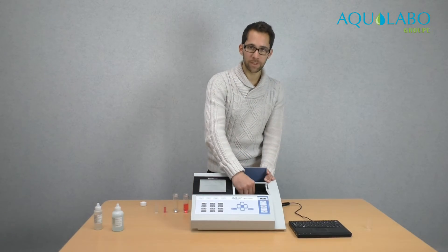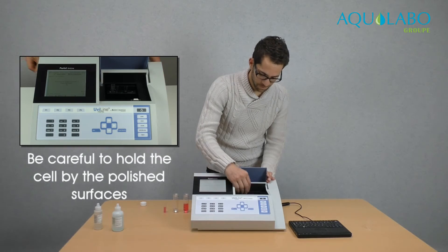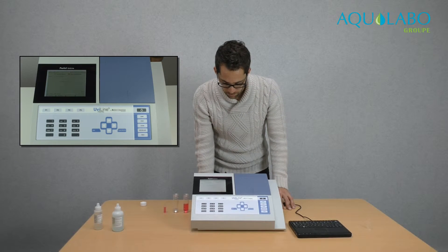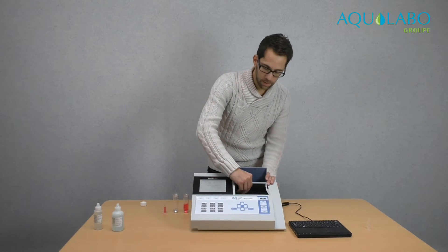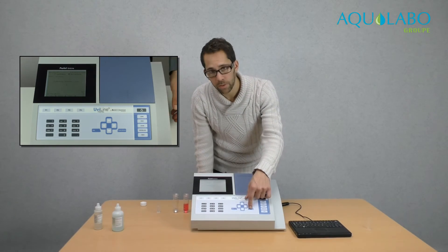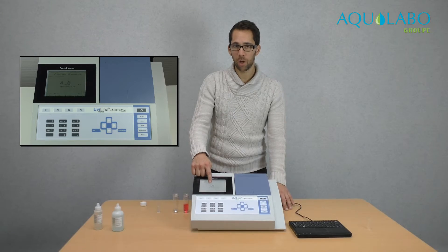Now I have to put a blank sample — that's a water without reagent. Then I press 0. I remove the cell and put the sample with reagents. And I press start. Here is the result in milligrams per liter of nitrates.